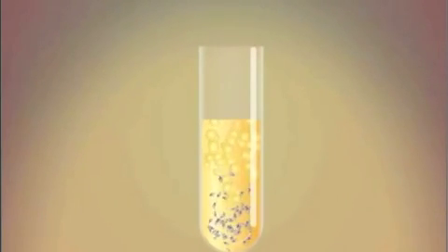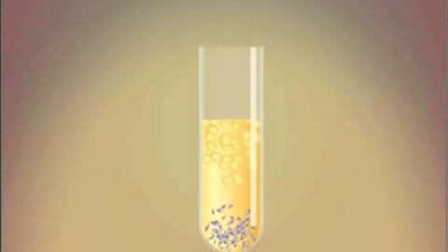Here you can see the stem cells, in purple, have separated and are at the bottom of the test tube.